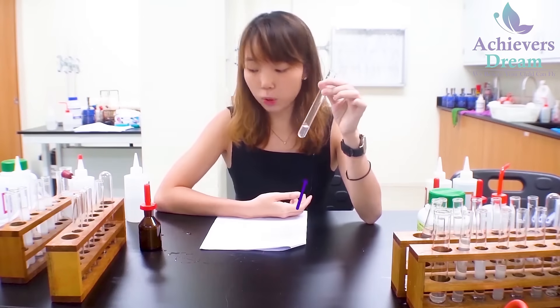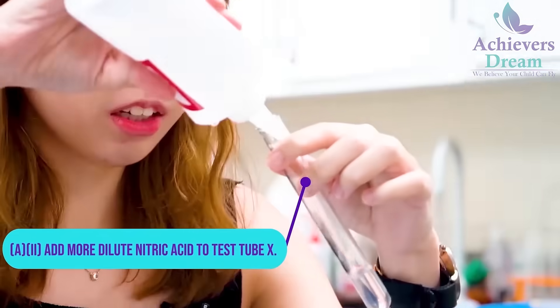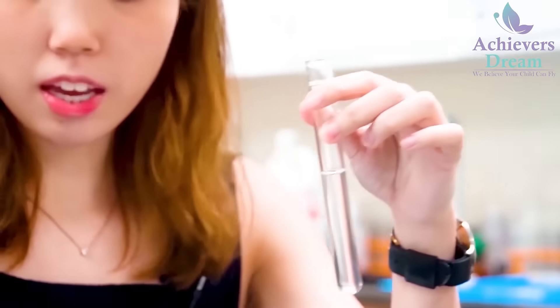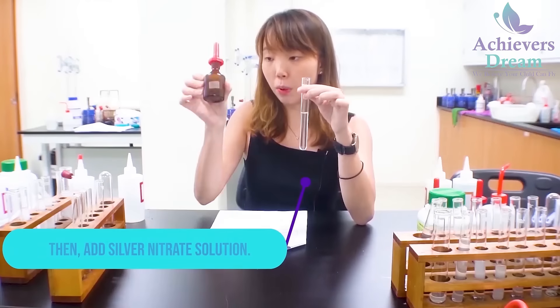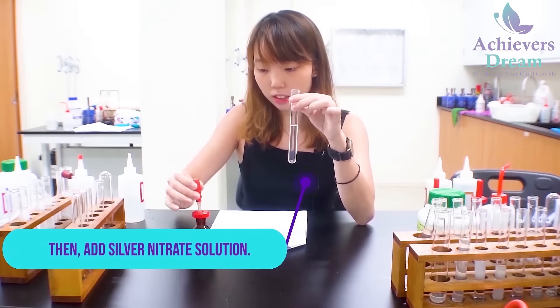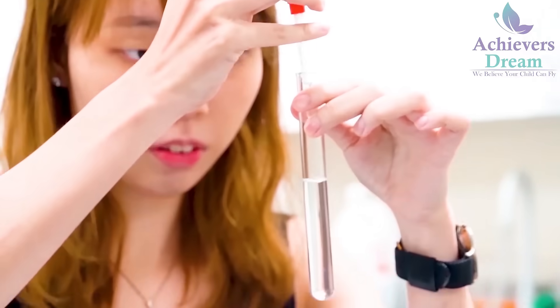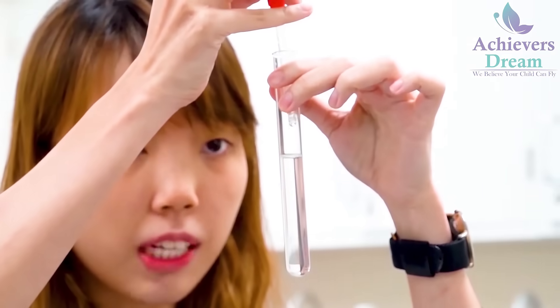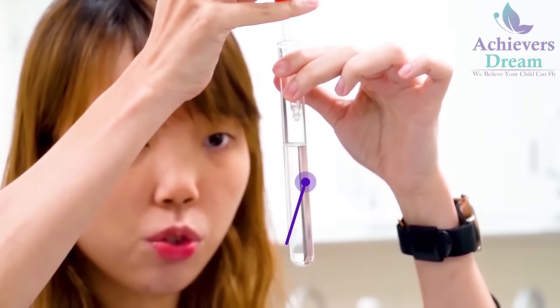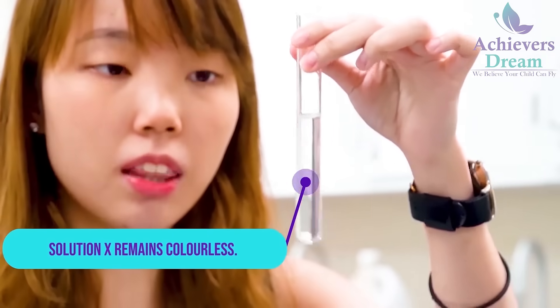For part A2, I'm going to add in more dilute nitric acid, then followed by 1 cm³ of silver nitrate. Even after addition of silver nitrate, the solution still remains colourless — there is no visible change.